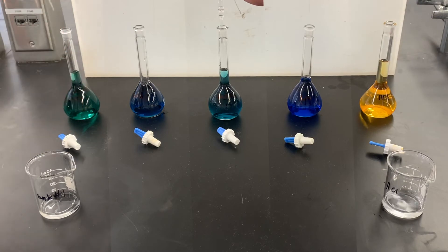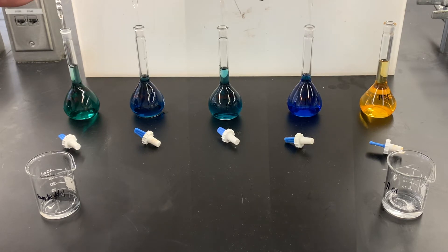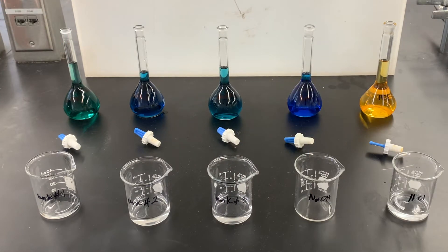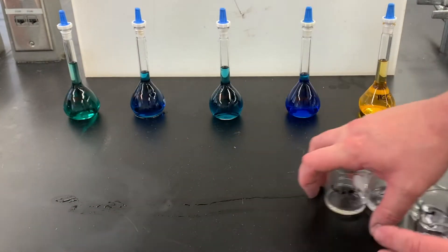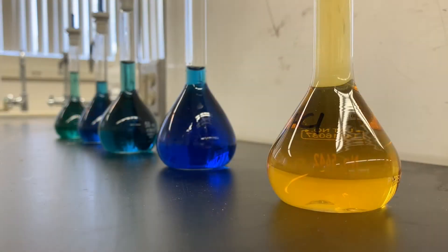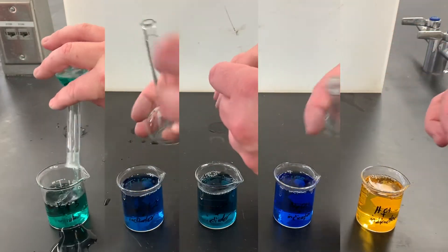Right there to the line. Once you have that done, you can cap all of them, and then you want to invert several times in order to make sure it is thoroughly mixed. You can see the yellow solution is only acidic, blue is only basic, and all of the different variations are green — some combination of acidic and basic. We can now pour this out into a beaker and take it over to be tested.